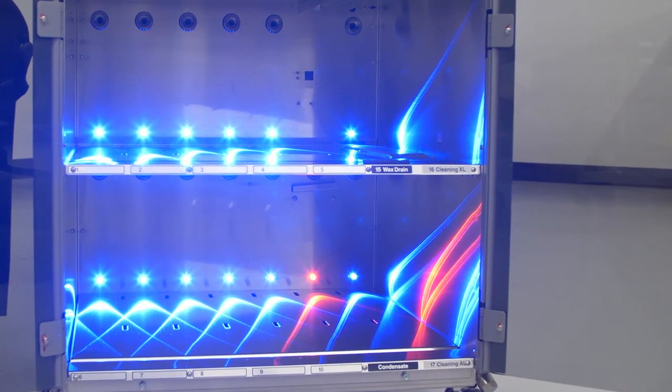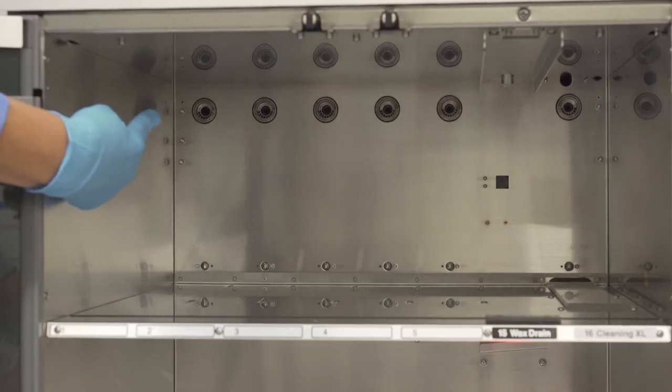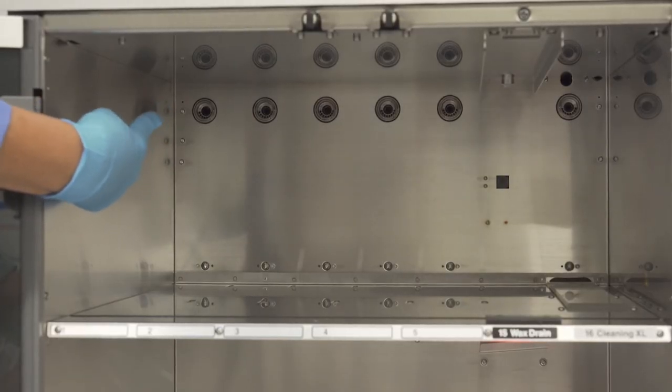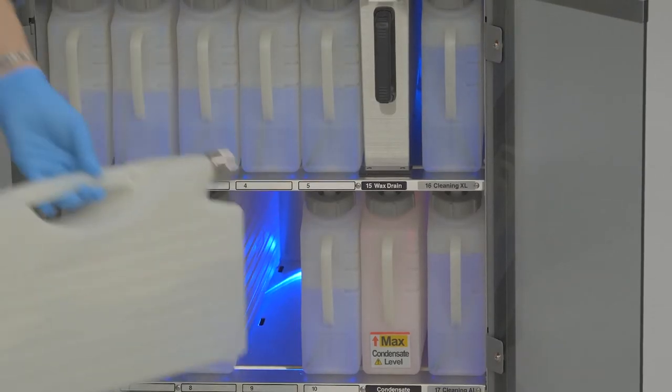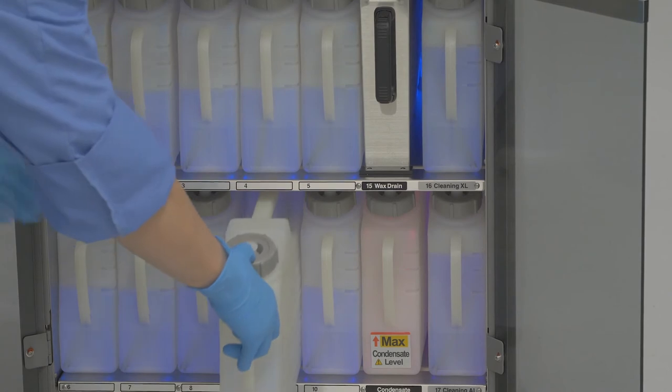Higher up on the back wall of the processor, you will notice the female connectors that connect the container to the unit. By clicking the container into place, a valve opens up that allows the fluid to move between the container and the retort.